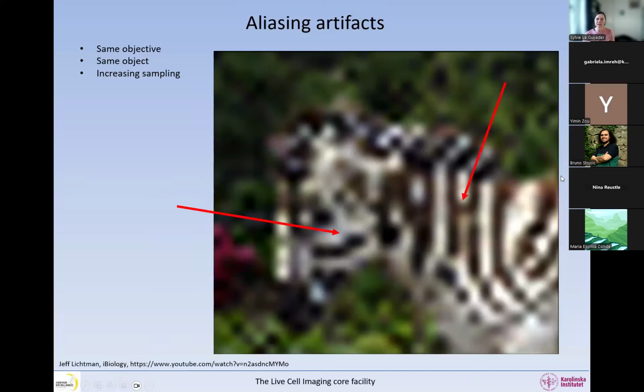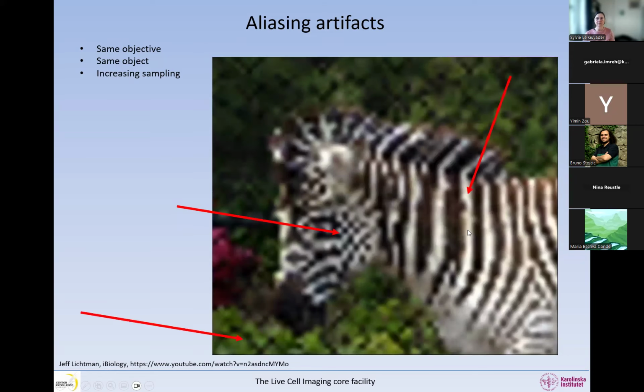And what you can see in here is that the zebra has very strange patterns. So in the next image, you will see the type of patterns we get here. But this type of crossing from one stripe to another never happens in nature. If you do not know it never happens in nature, you would not be able to identify this as an artifact in the image.